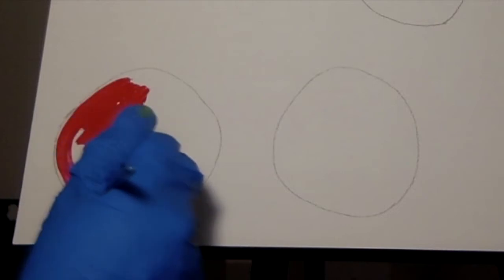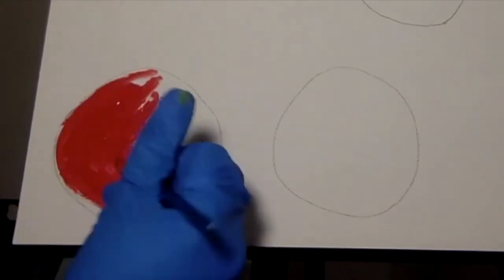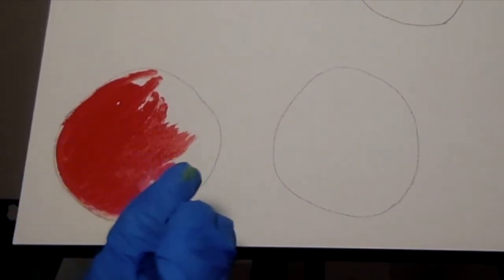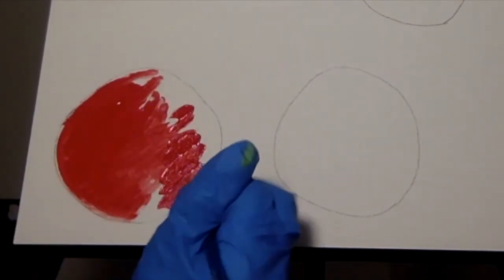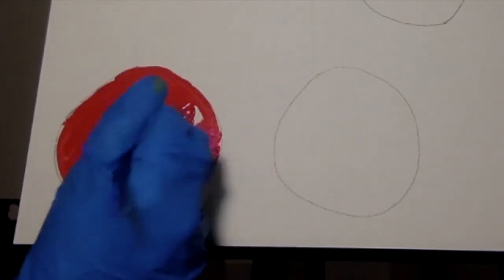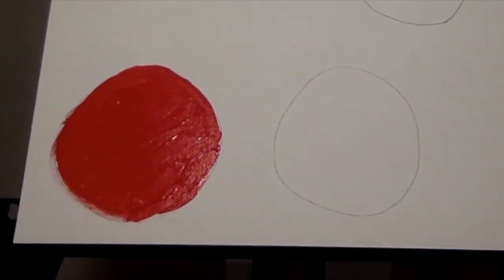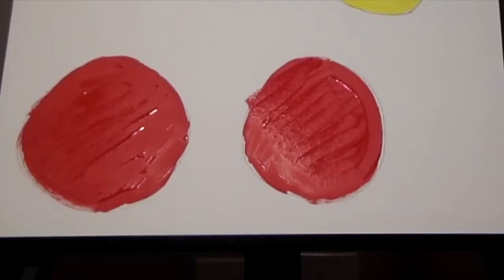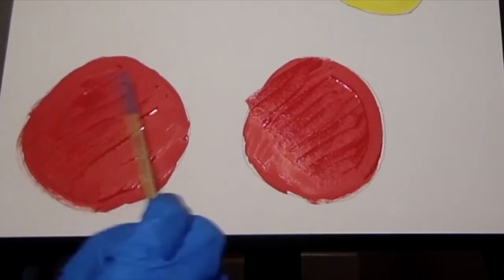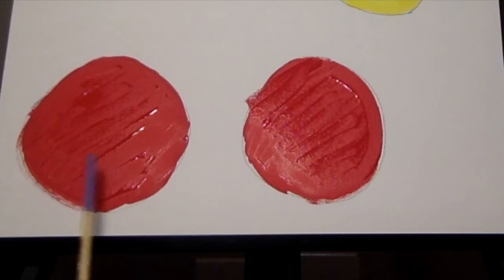Culturing in media can also be used to learn more about characteristics of our S. aureus. In this example, I will be using a mannitol-based media, which is shown here in red. On the left will be our Staph aureus bacterium, and on the right will be another Staphylococcus species. I'm going to inoculate both plates with their respective bacteria, the S. aureus on the left and our other Staphylococcus on the right.